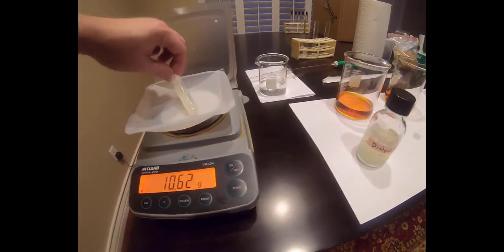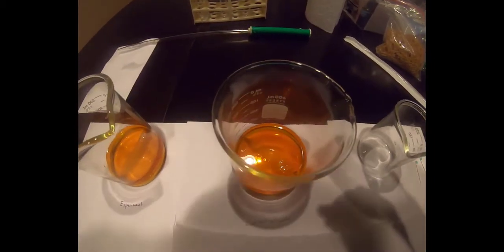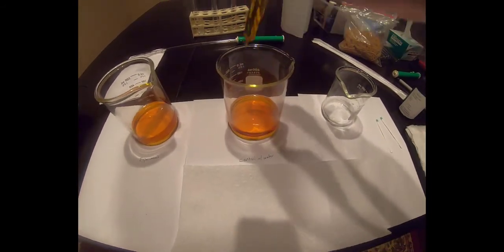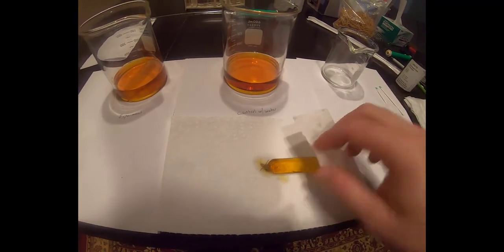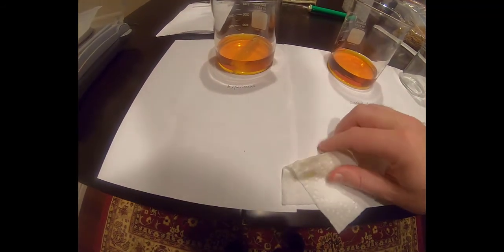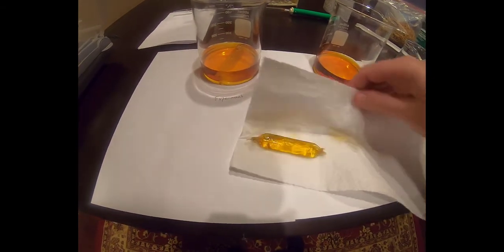I then place the experimental bag into the experimental beaker on the left. After 75 minutes, I retrieve the control bag from the control beaker and blot dry the bag to remove any extraneous water. Note that the contents of the bag have changed in color. The bag contents are now light brown when initially they were clear. This indicates to us that the Lugol solution from the beaker has penetrated into the bag. You should record this color, light brown, as the final control bag color on page 2 in the table.